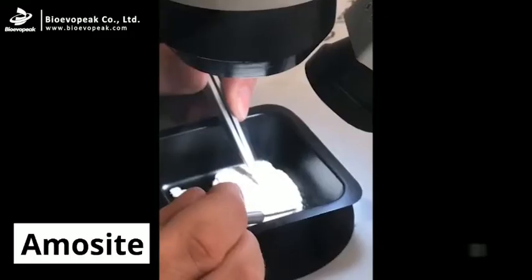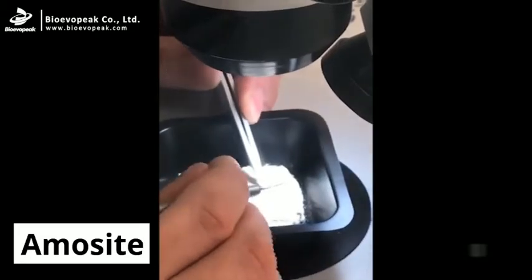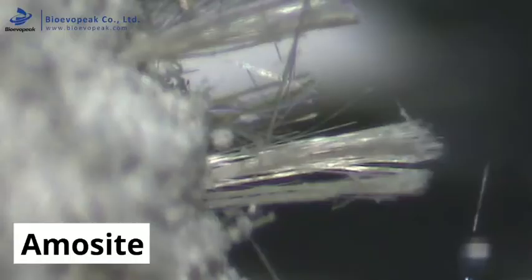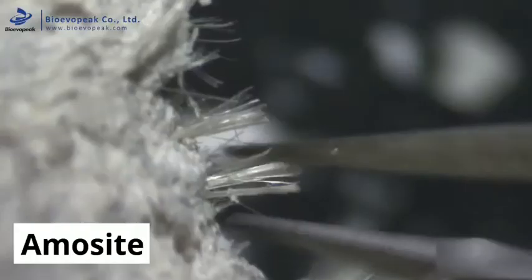Amosite, or brown asbestos. Here you can see a sample of suspect insulating board. Firstly, the sample would be prepared and then assessed under the stereo binocular microscope. The analyst searches through a sample to locate and identify suspect asbestos fibres.